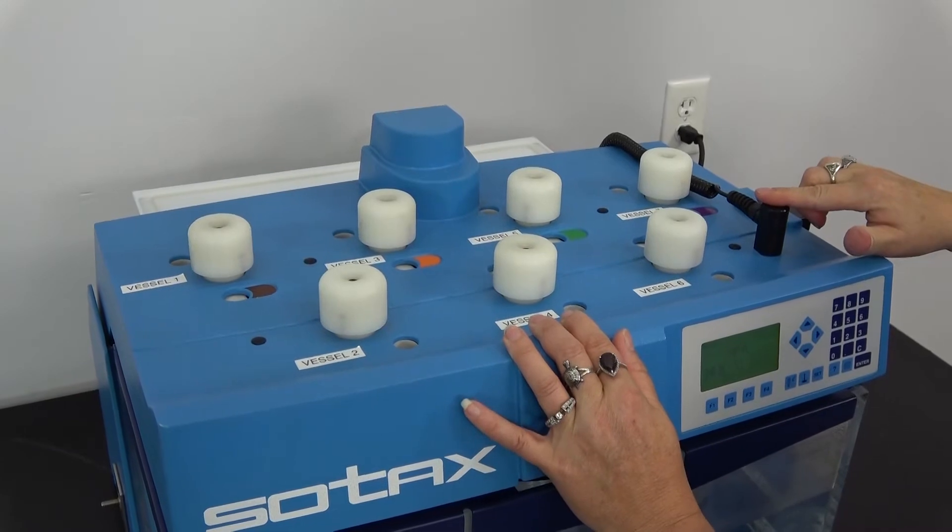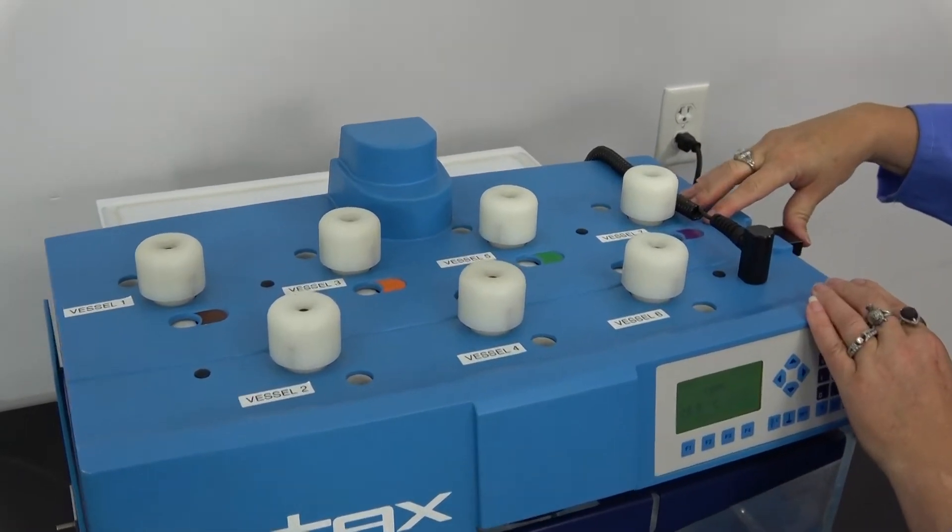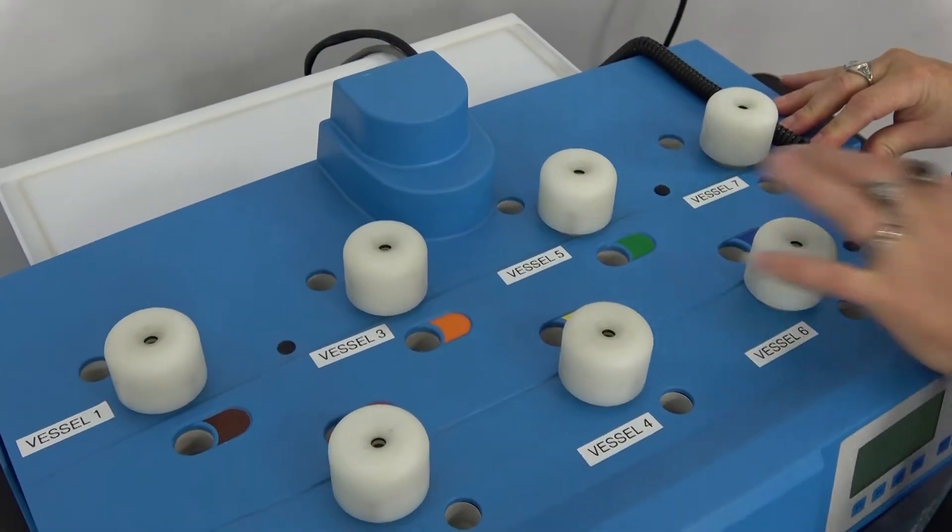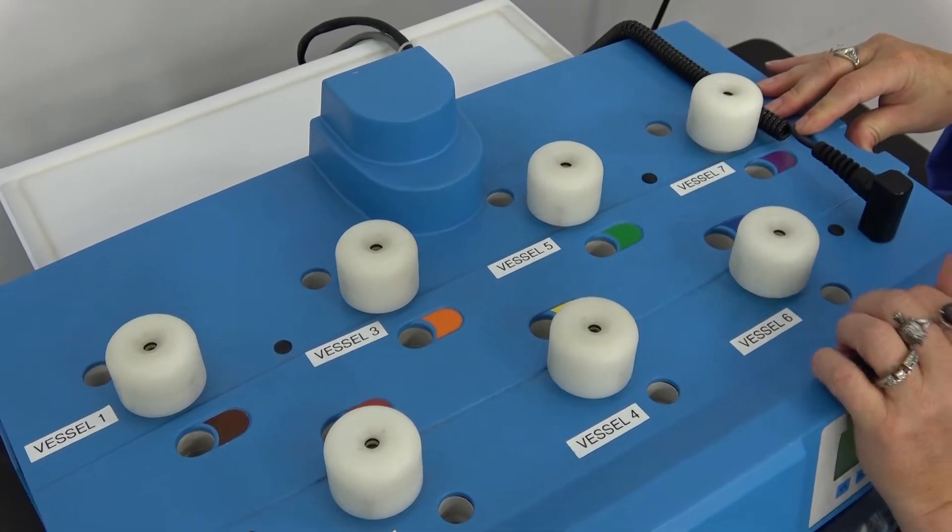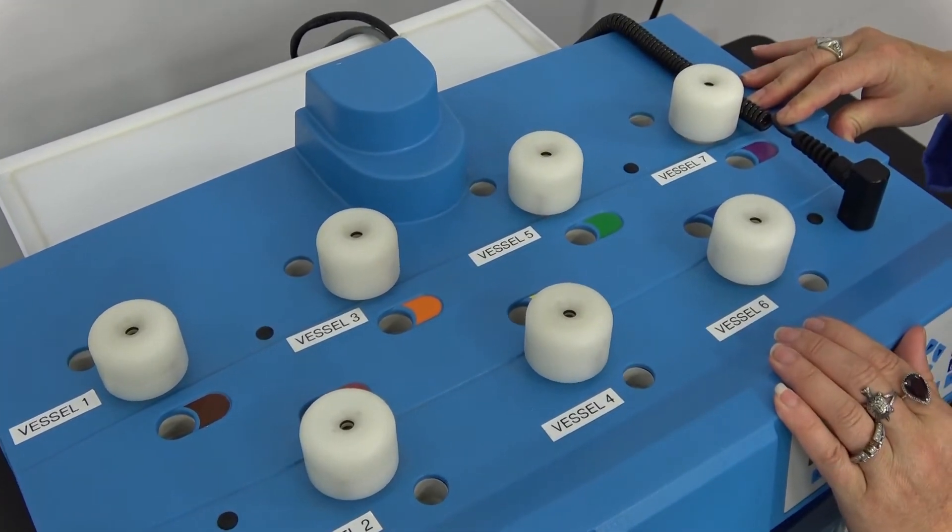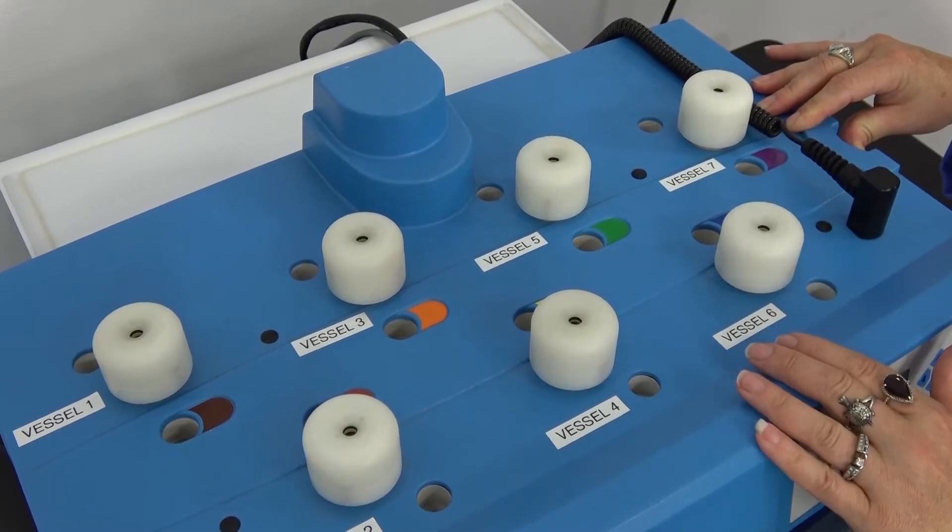There is a temperature probe. This button here opens the holes so that you are able to put in your capsule, pellet, sample, or whatever you happen to be testing.